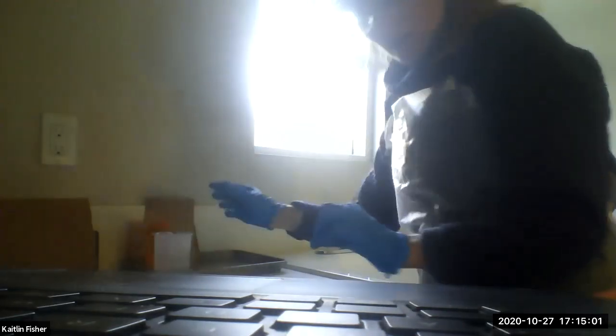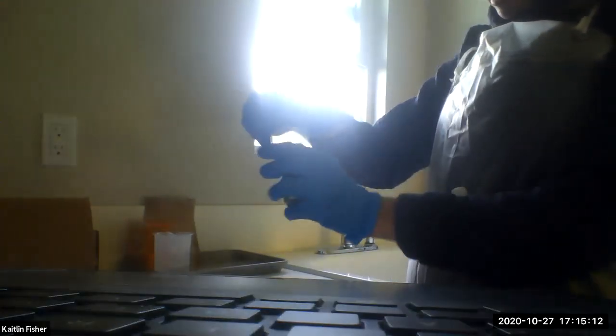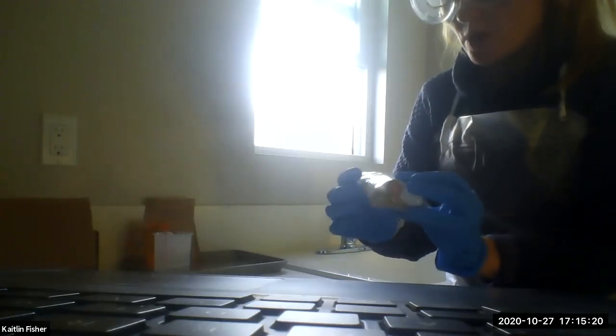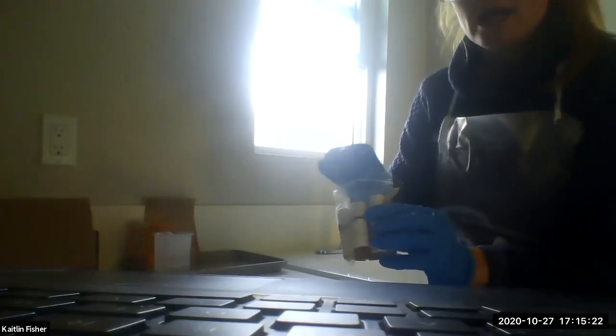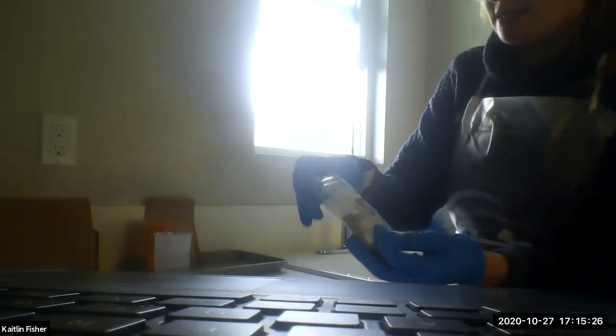What you'll be doing is using ethanol to extract this. So you want your willow bark, and we'll put that on our reagent tray. Then you're going to have a smaller self-contained bag, and this is going to have your reagents in it. If you open this up, note that before you touch these, make sure you're using gloves, because in case any of these bottles have leaked or there's anything outside of the bottles that we don't want to touch, we want to make sure we have a gloved hand.